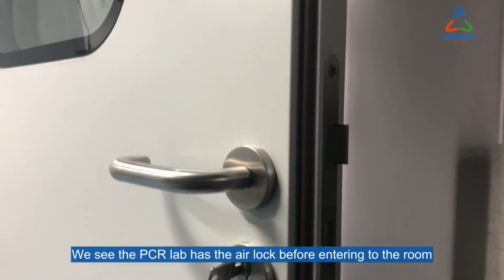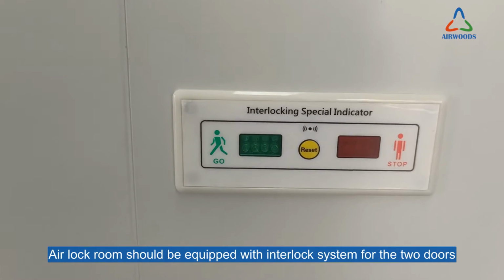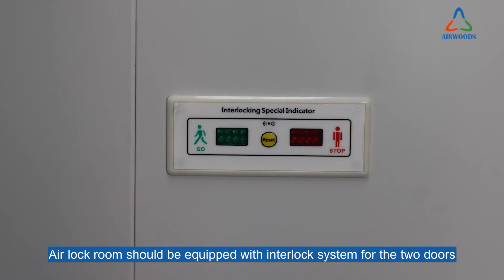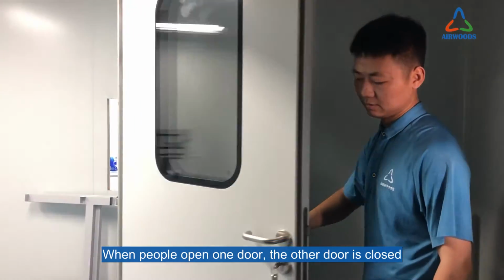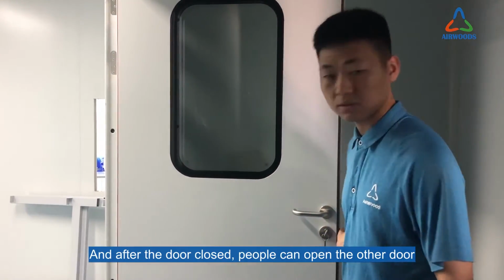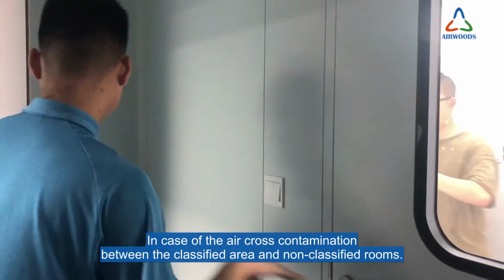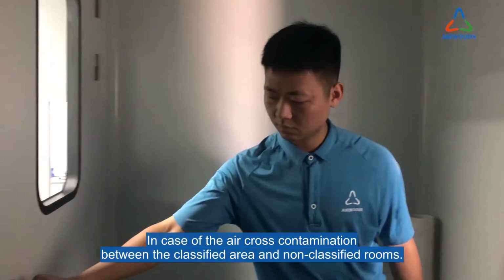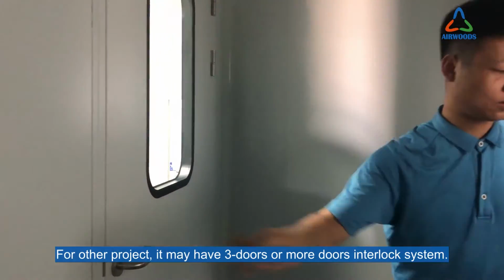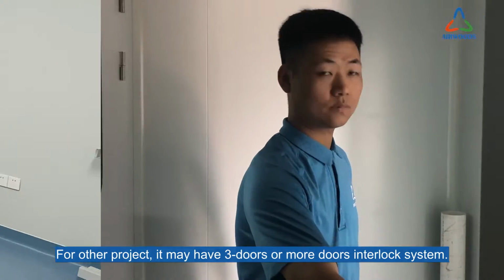You can see the PCR lab has an airlock before entering the room. The airlock room should be equipped with an interlock system for the two doors. When people open one door, the other door is closed, and after that door is closed, people can open the other door, in case of air cross-contamination between the classified area and non-classified rooms. For other projects, it may have a three-door or multi-door interlock system.